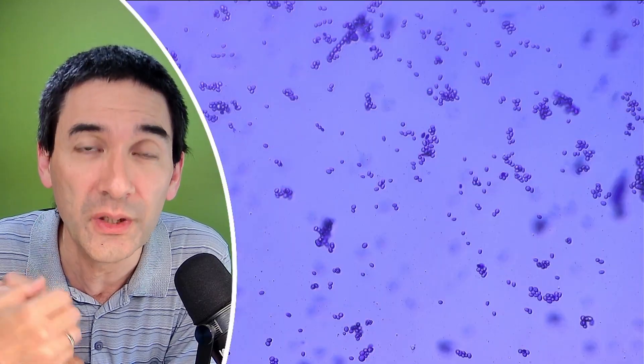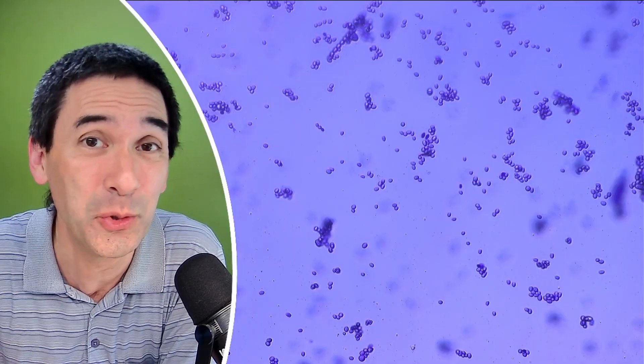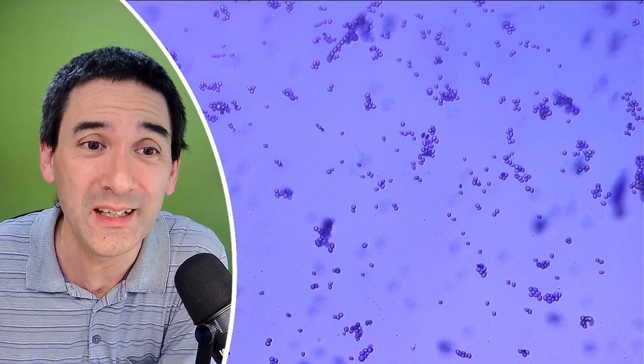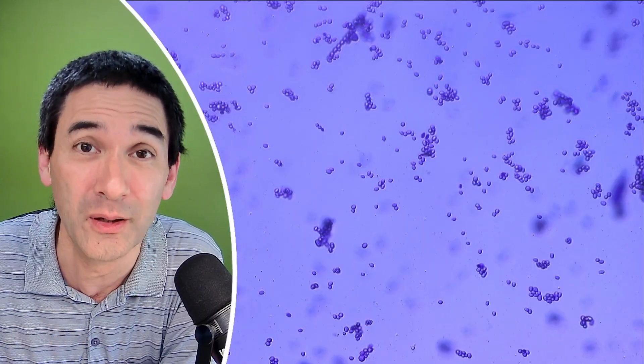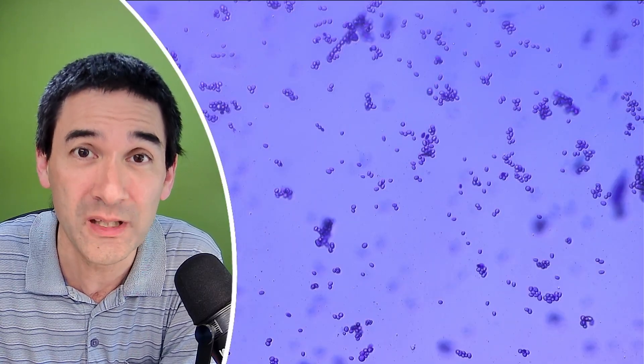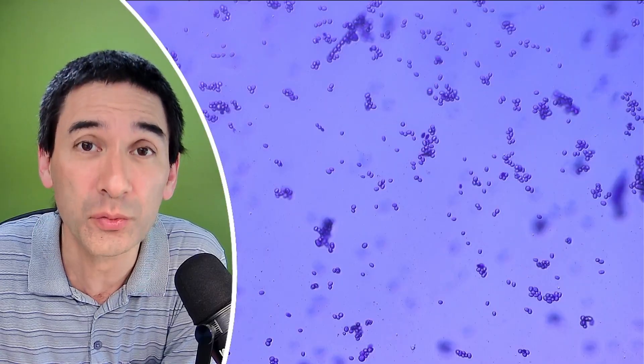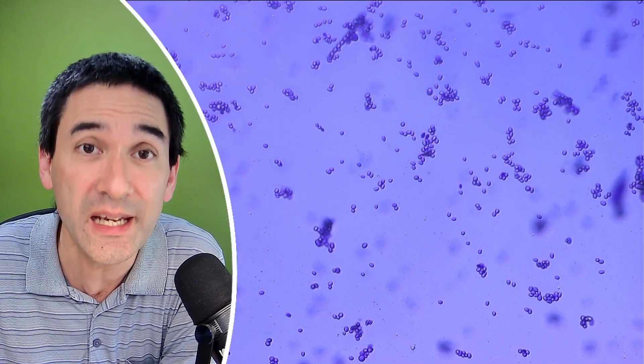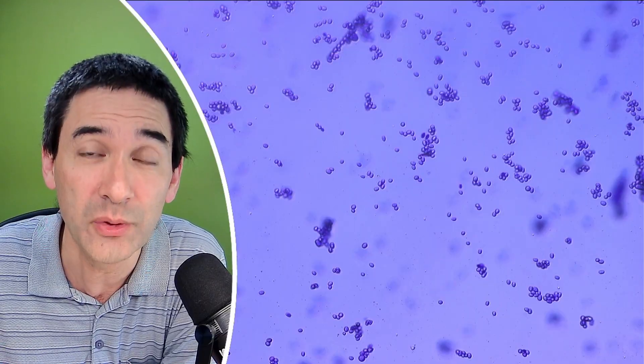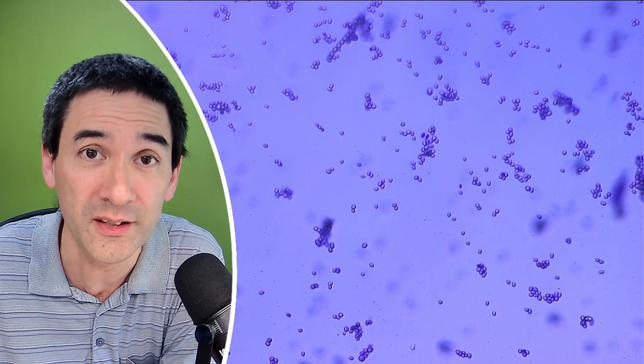If you do not dilute it enough, then everything is going to be dark blue and you're not able to see anything. So getting the correct concentration is right and that's why I added a little bit of additional water on the microscope slide. So if you want to remove now some of the surrounding blue stain then there is a trick that you can use and I'm going to show that to you again.